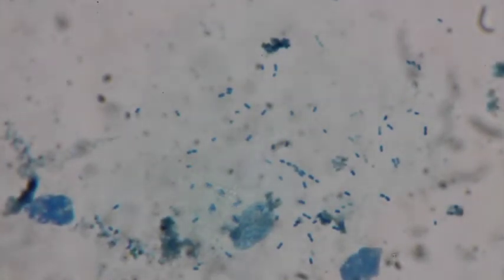Okay. And not doing too well. And getting the focus, there we go. I have to slow down on that focus to be able to get it. Beautiful. There we go. Nice.